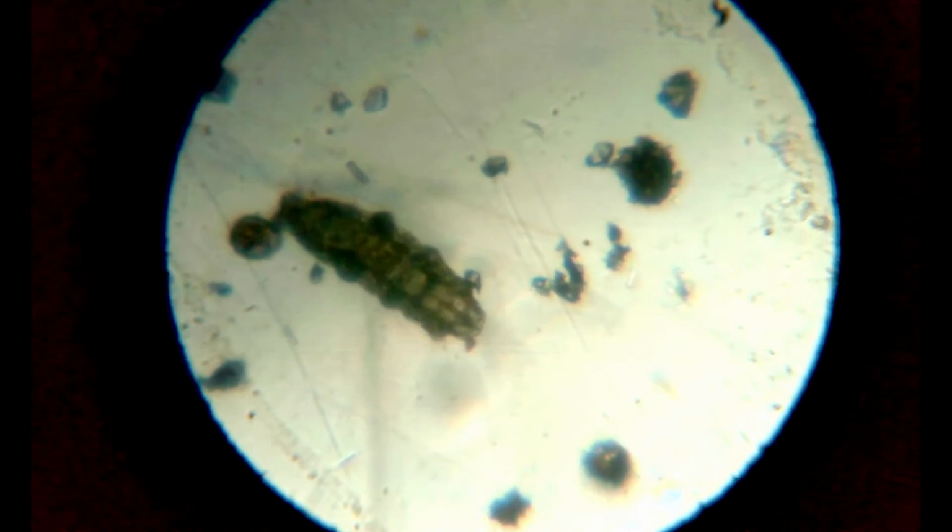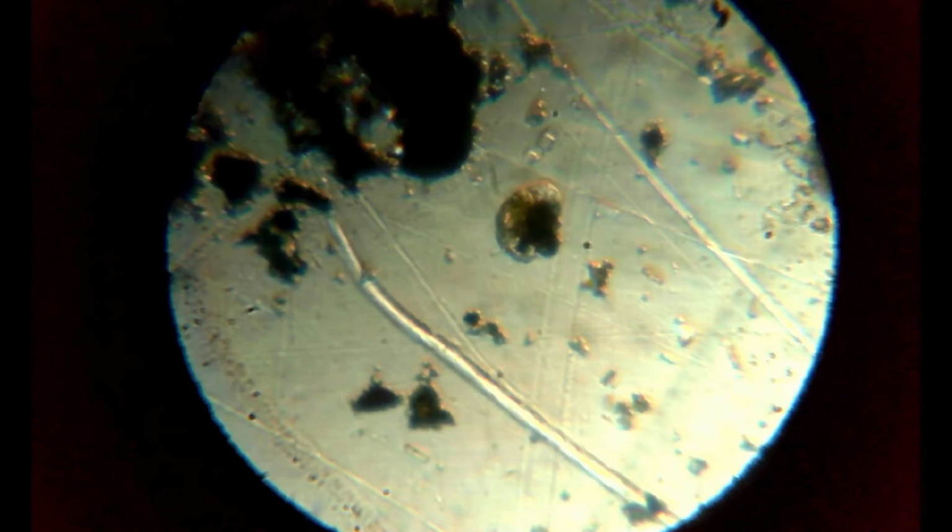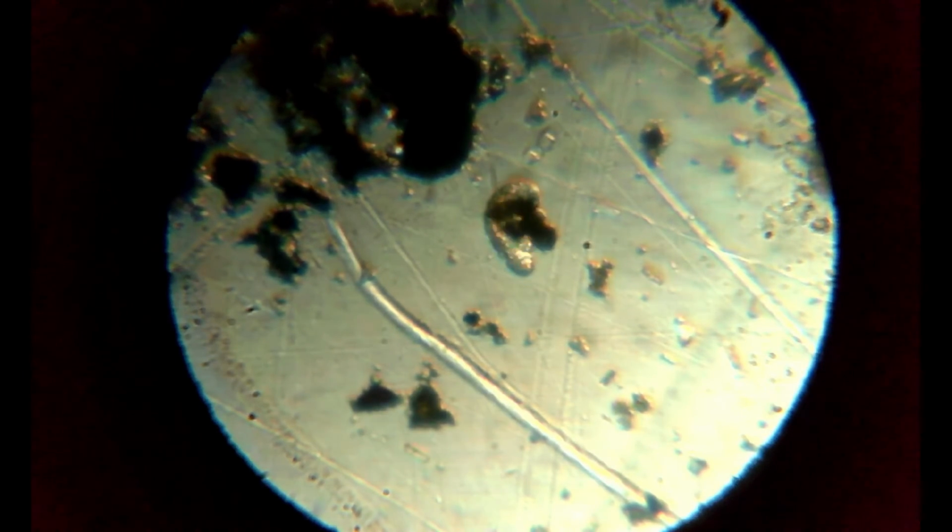I got lucky with that moss sample and I found quite a lot of them. Here's a really tiny one, for example. And here two at once.